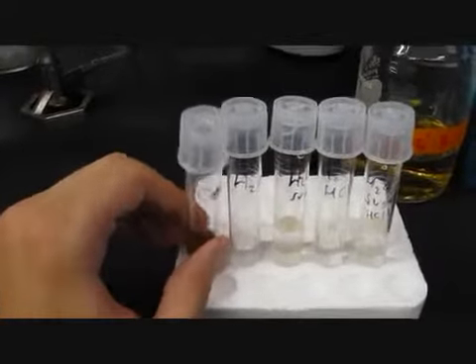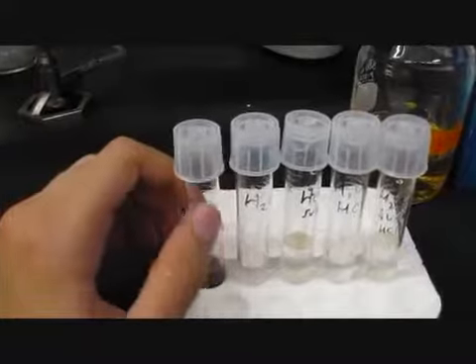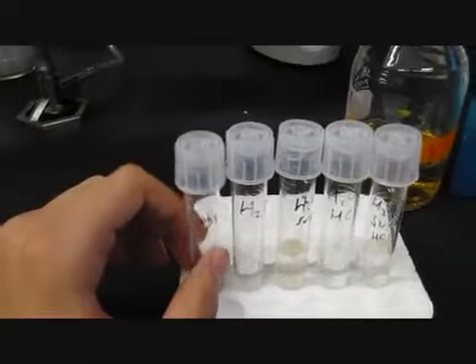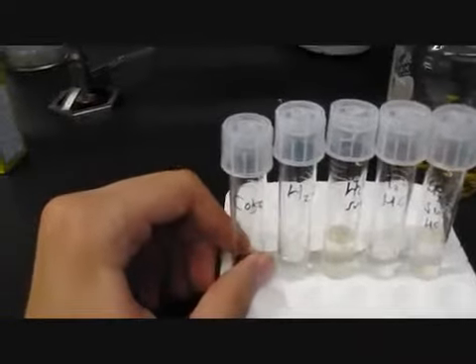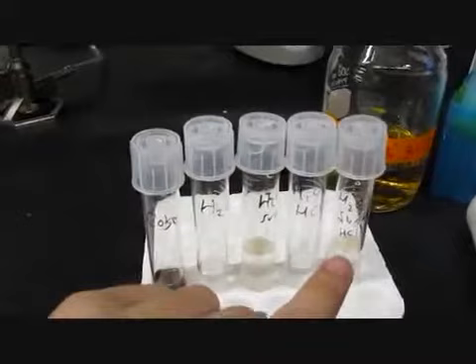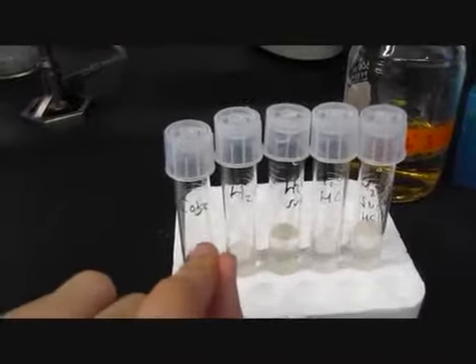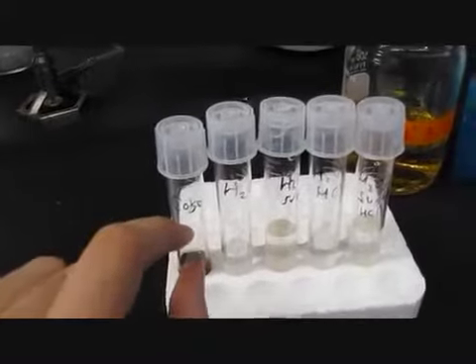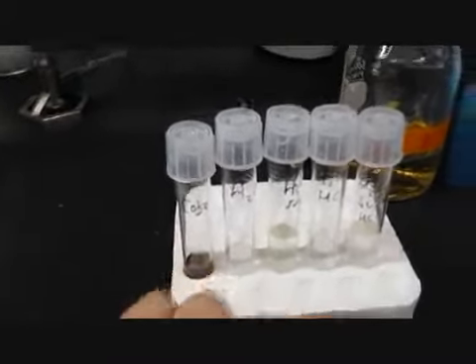To mimic the Coke, which also has low pH and high sugar content, we had the H2O and HCl and sugar. But in case there's something extra in Coke that allows for bacteria to grow or not, we'll know because we'll be comparing these two especially.